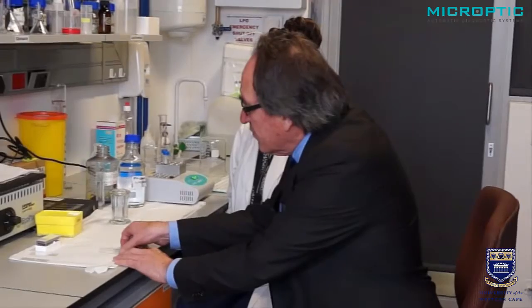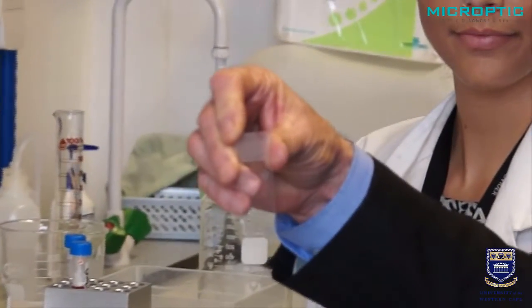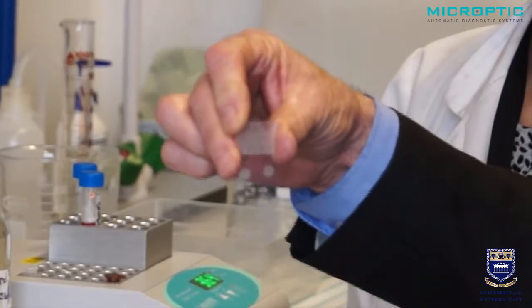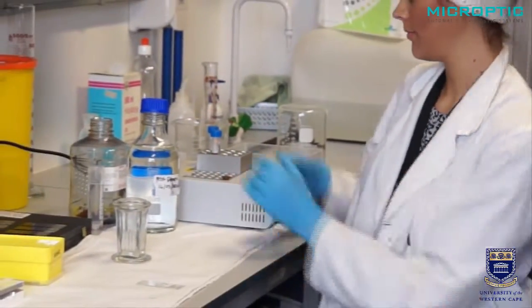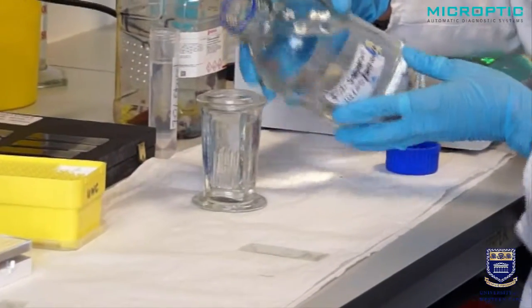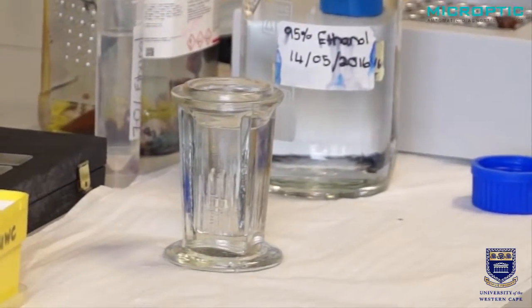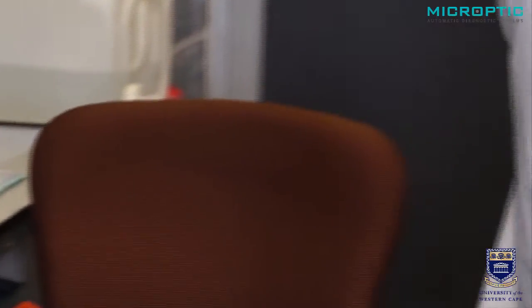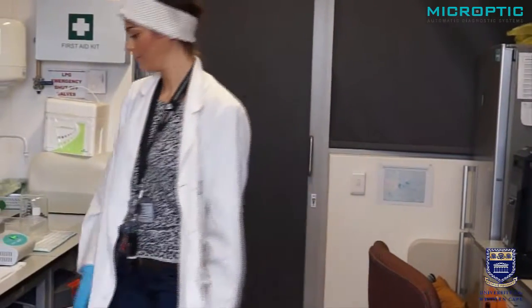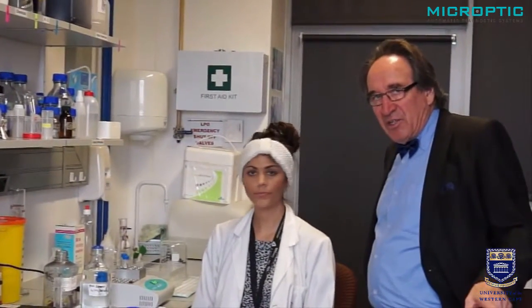Let me show you how it looks. You can see here two droplets at the bottom and two at the top — they almost appear as little whitish discs. Those are now completely dry. The next step is to fix it in 95% alcohol which has been pre-cooled to 4 degrees centigrade. It is immediately taken to the fridge where it is kept for 30 minutes. Fixation time is exactly 30 minutes at 4 degrees centigrade in 95% alcohol.